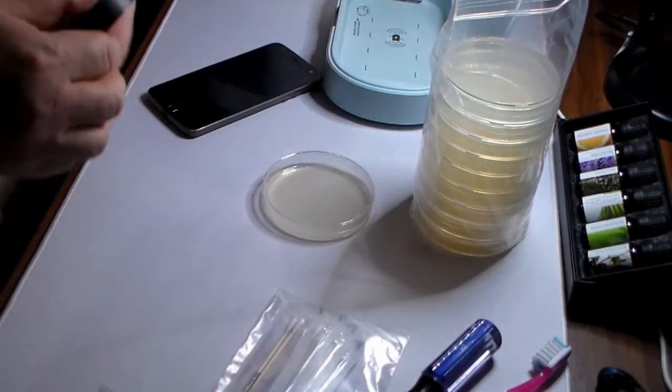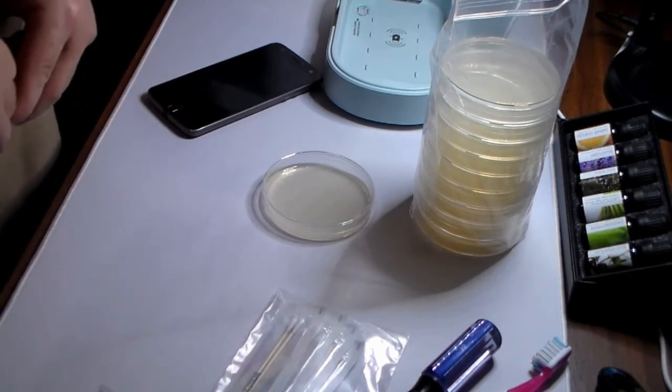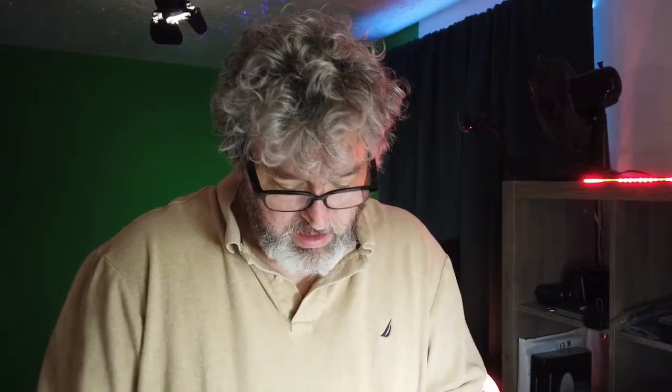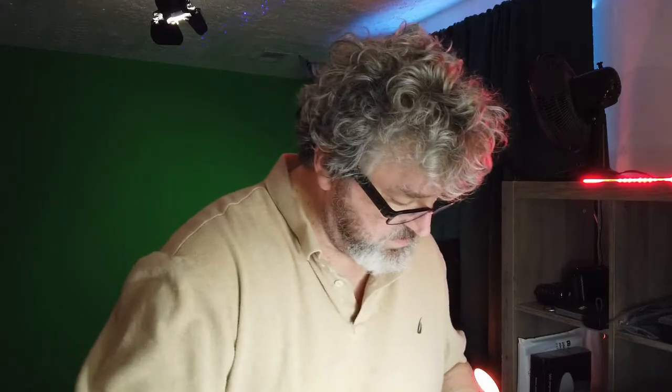We're going to seal this with, I have electrical tape. I'm an electrical engineer. This is what I have. This is what I will use. We're going to tape this closed. We're going to label it. We're going to put it in the incubator.